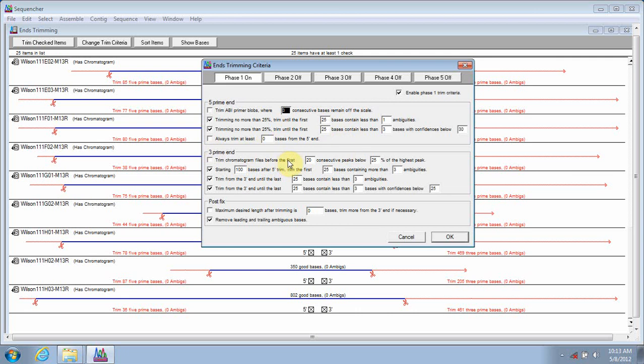On the 3' end, you can choose to trim based on peak size. At the bottom, once you trim from both the 5' and 3' ends, you can choose to do a post-fix truncation. Also, you have multiple phasing options for your trimming. This can come in handy if you would like to set default trim parameters for a variety of different projects that you have going, or if you're a more conservative trimmer.